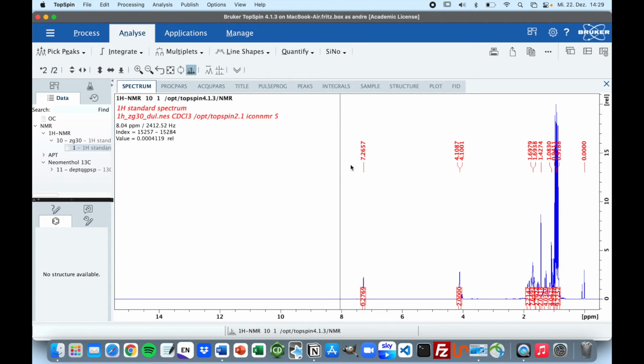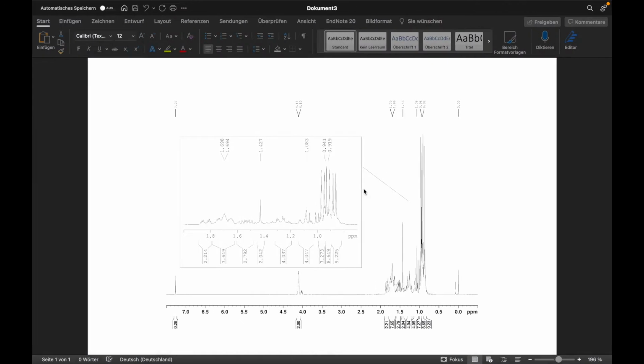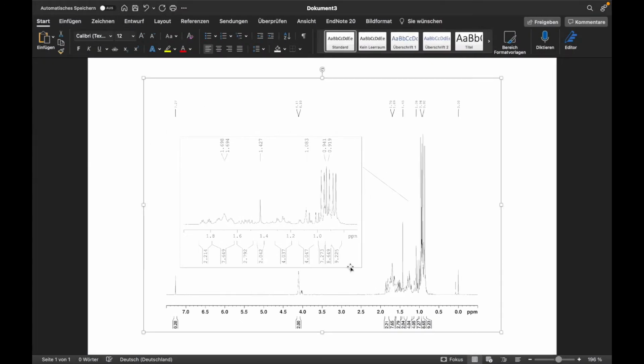In this video I'm going to show you how you can go from a process spectrum like this in Topspin and plot it into a professional looking spectrum with an inlet inside it, so you can zoom in on compact areas like this.